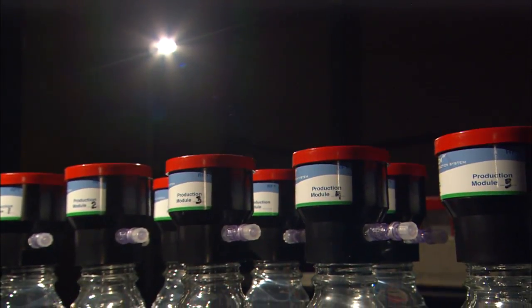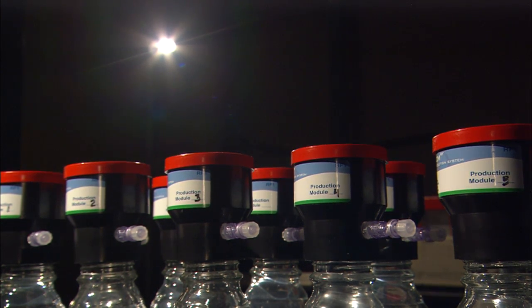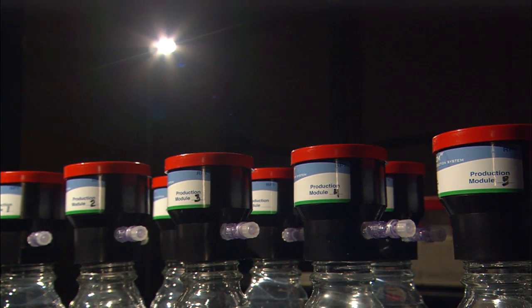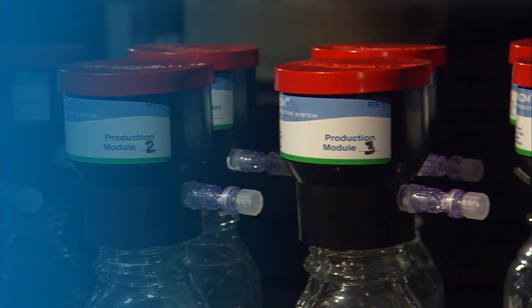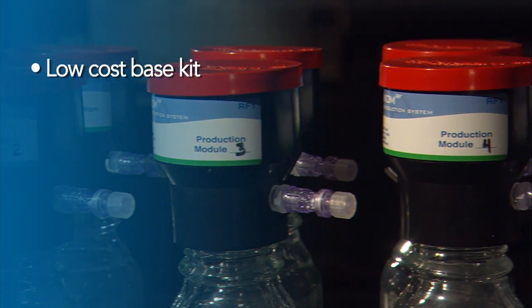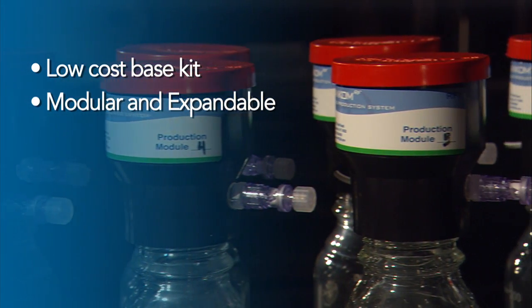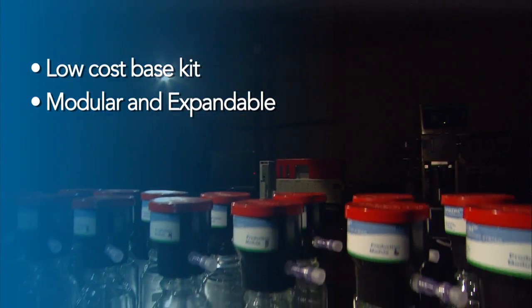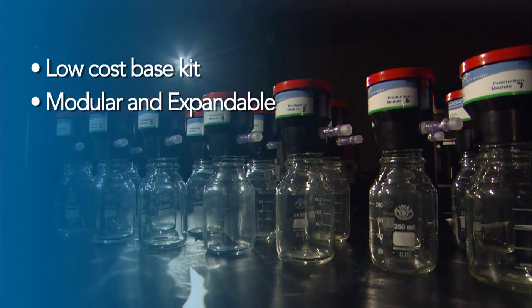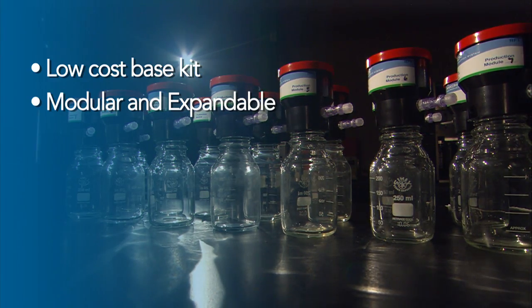Designed for expandability, up to 50 RF1 modules can be used with one base kit. Up to five kits can be operated in a single lab. The RF system provides a base kit that includes five RF1 modules for a low-cost entry. It is modular and expandable, capable of up to 50 RF1 modules on a single base kit, allowing the user flexibility in study design and the capability to test a number of variables during a single test.